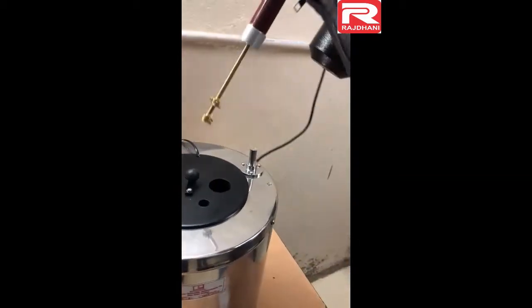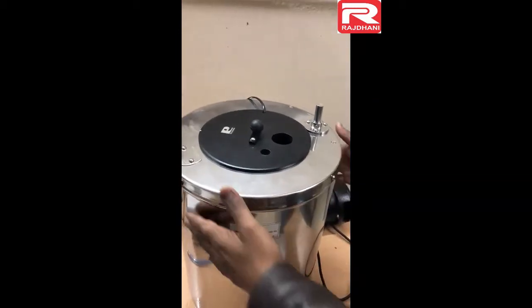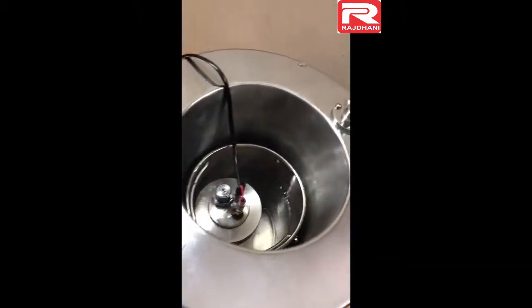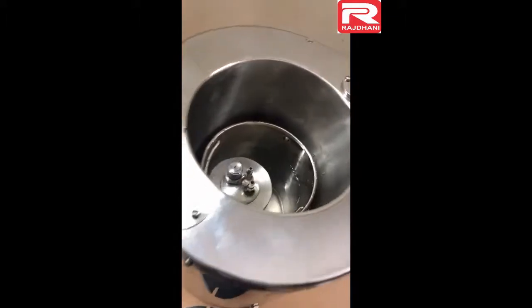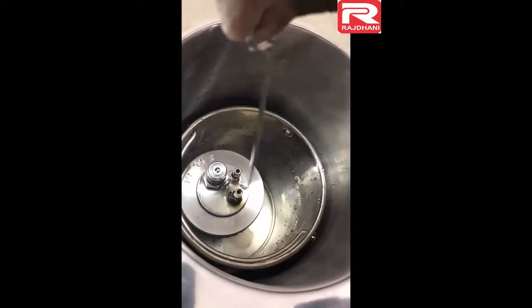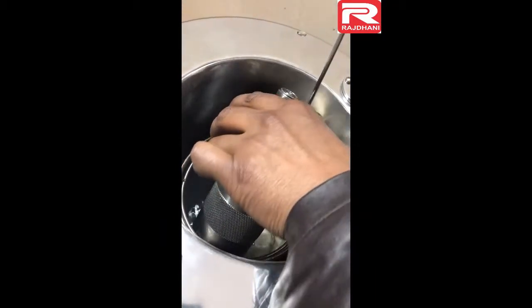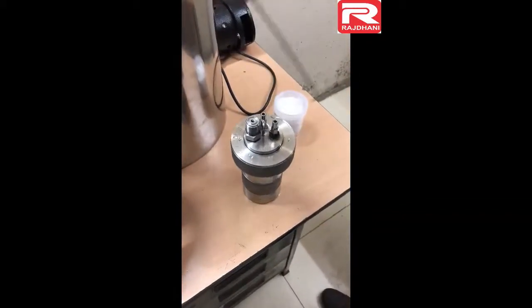We will take out the sensor and keep it to the back side. Then open the combined lid, remove the lid, and take out the bomb using the bomb-lifting handle.